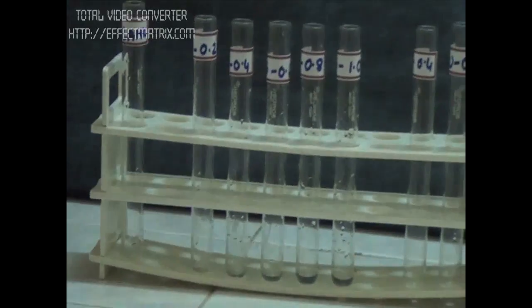Now in my pipette, I am having 0.8. In the last standard aliquot tube, we will take 1 ml of standard RNA solution. So we are done with the aliquots of the standard.